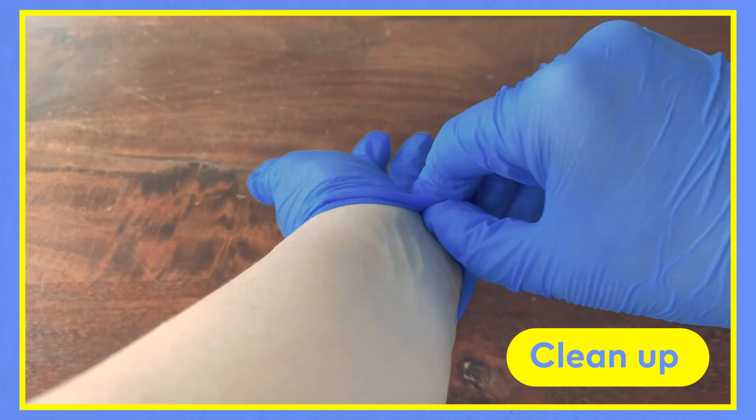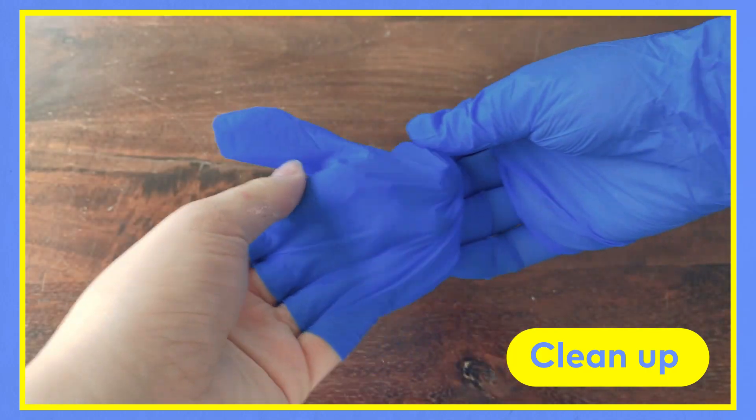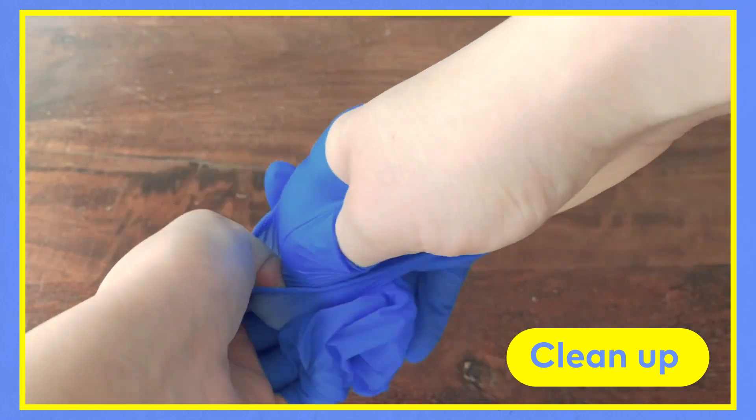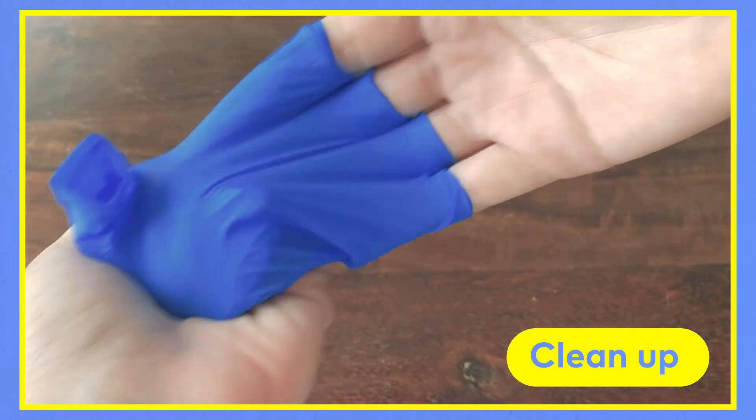Take off your gloves. You can use this technique: take out one hand, and before you take the other glove off, use your thumb to get the other one and wrap it around.